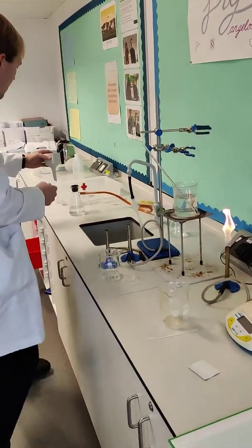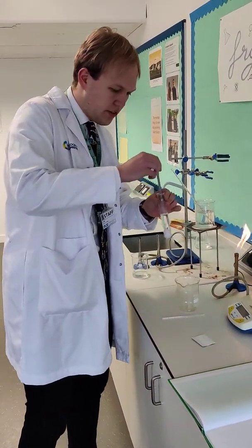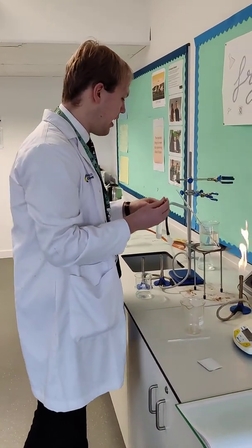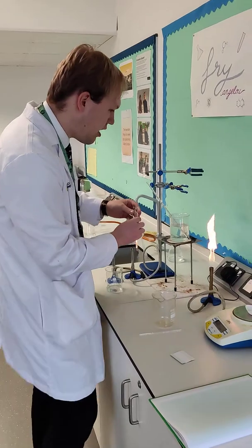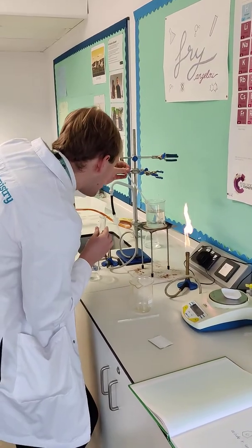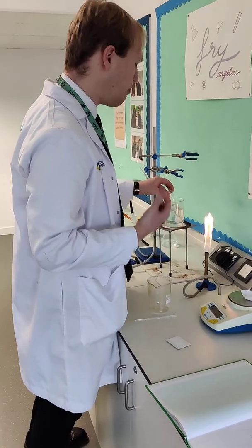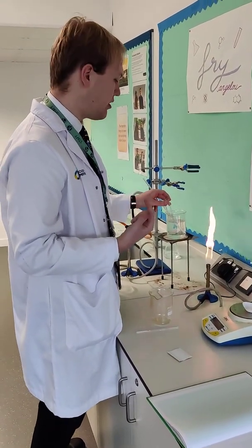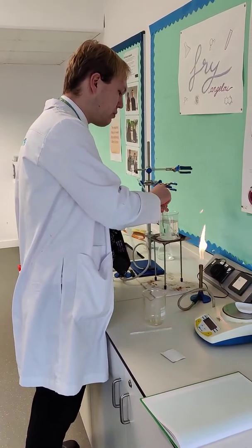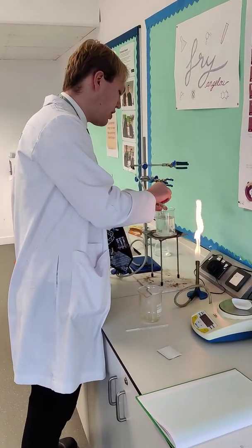So what are we going to do next with this ethanol in the boiling tube? We've got the ethanol and crude product mixture — just give it a swirl. We're going to place it in a hot water bath, heated using the Bunsen burner. At the moment it's at 79-78 degrees Celsius, which is really important because ethanol boils at 78 degrees Celsius. We don't want it higher than this temperature, because the ethanol will start to boil off — and that's the solvent we're using, so we don't want it to run out.